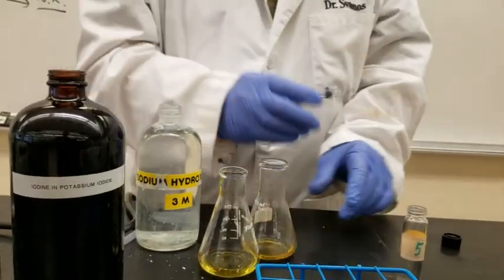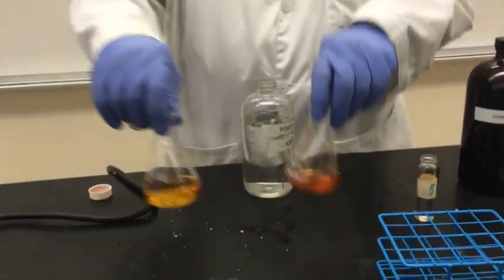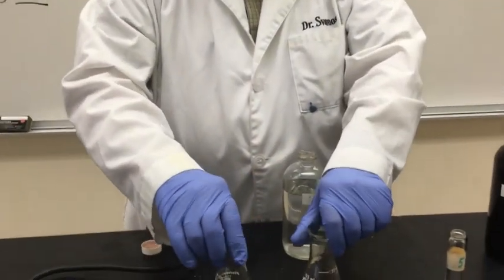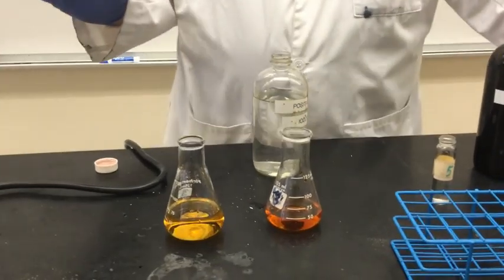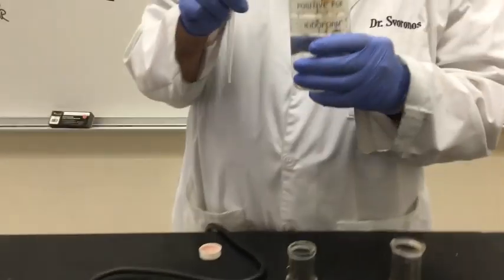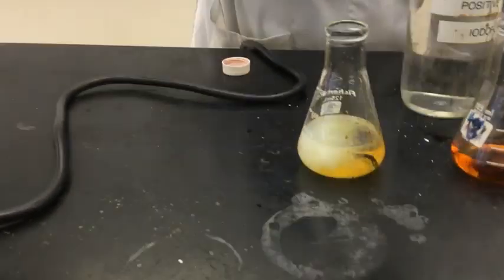Okay, so what we're going to do now is we're going to take. So now here we go, we have the two solutions. Yes, one of them is a little bit more darker than the other one, but that's all right. Our aim is not to get the solution red or yellow. Our aim is to make sure the solution actually creates a precipitate. So first of all, we will work it out with a compound that is called positive iodoform. So we add a little bit of the compound here, and here we go.